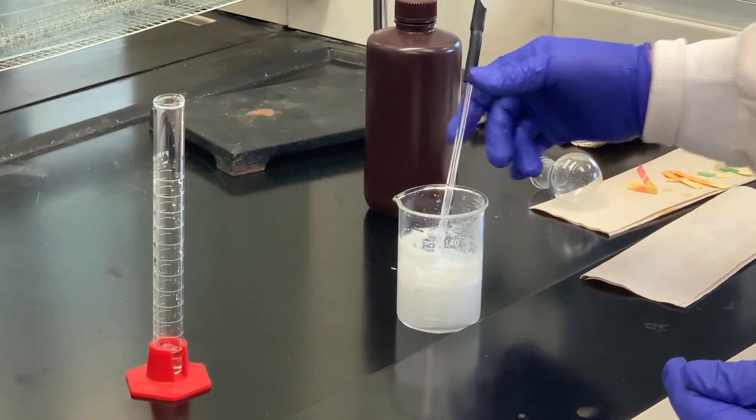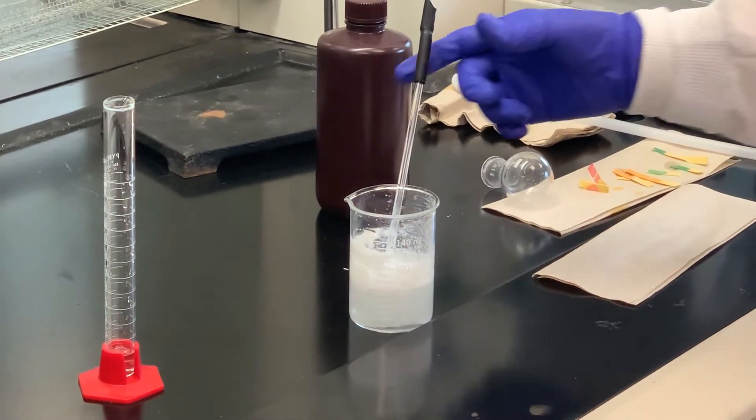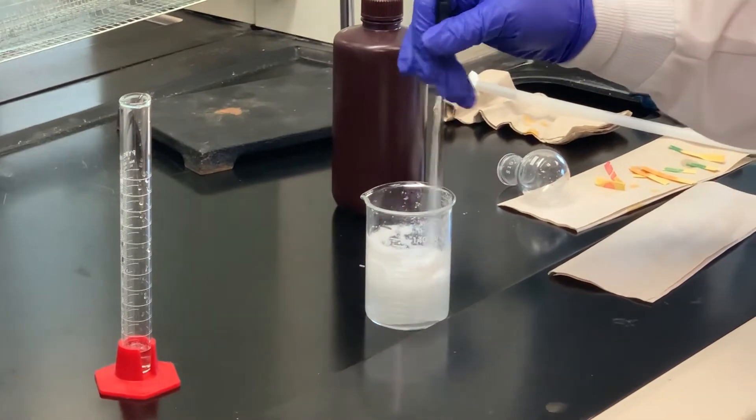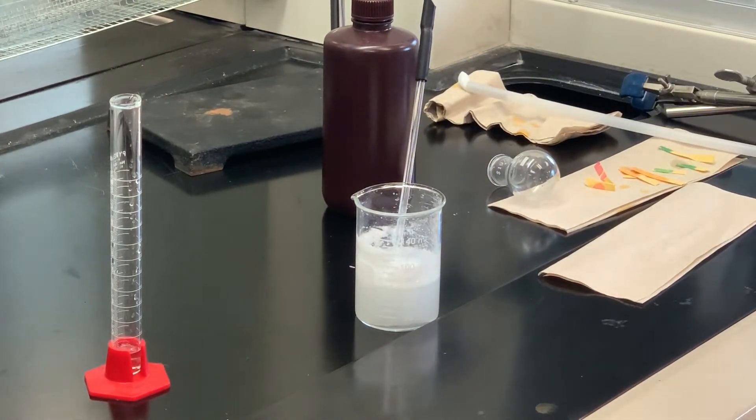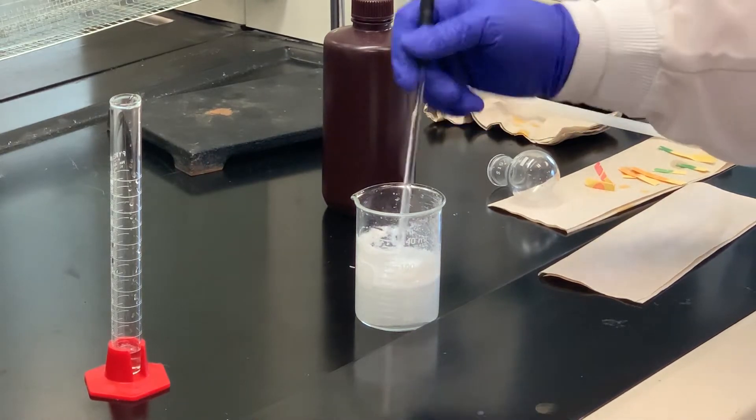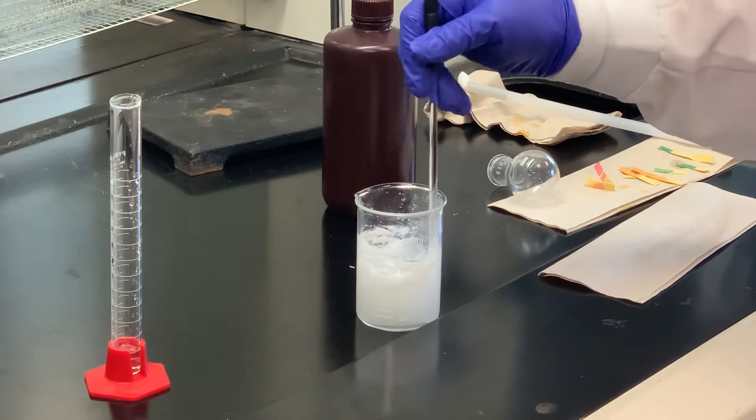It is possible to do a recrystallization, we'll take a look at the melting point. The problem with this particular reaction, since it is equilibrium based, we're not going to get a great yield. And I'm afraid if I try to recrystallize it based on the one gram sample I had, we may not get very much back. So I'm going to see what we get and see how pure it is, and then we'll make a decision from there.